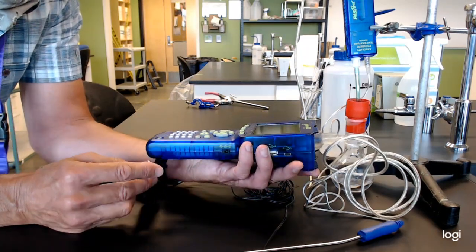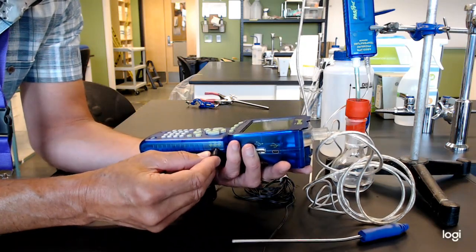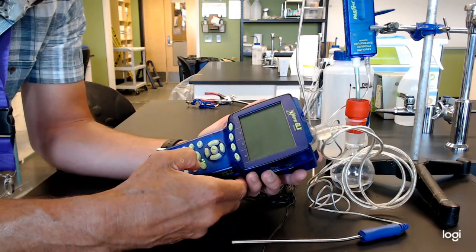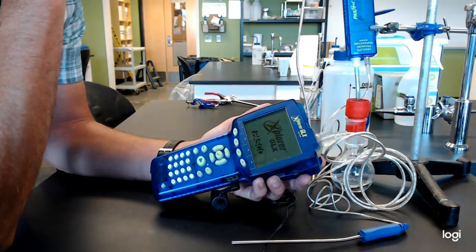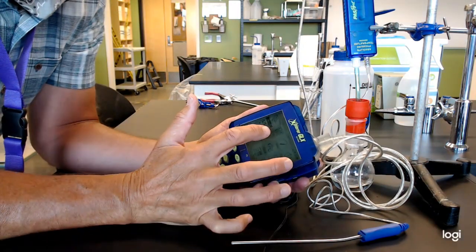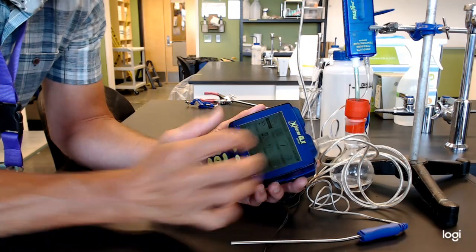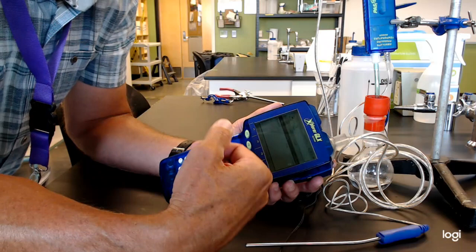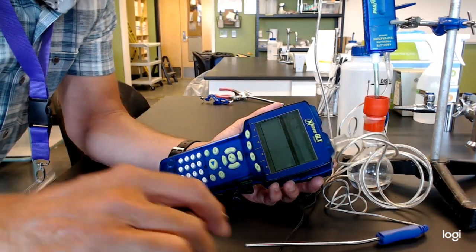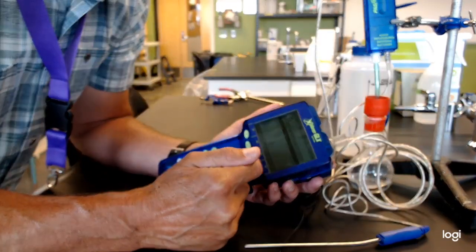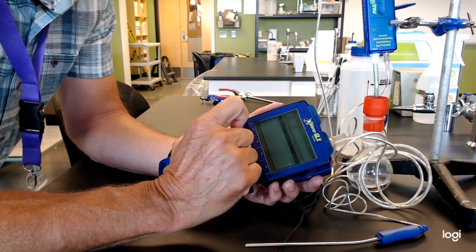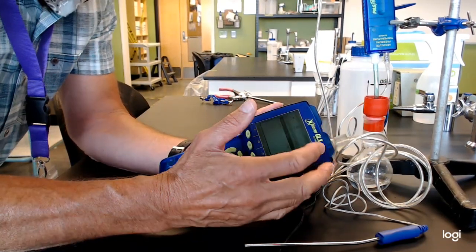There are features to save to files. With the time you have in lab, it's up to you whether you really get into training students on how to do that. But maybe I'll just show you real quick just so you guys know how to use this. Right here is the main thing that comes up on the home screen in the top left is actually the data file. So if I click that once, I'm actually looking at the data file. Just heads up, on here it says flash. That does not mean this flash drive. That is the memory for this. And then it has RAM. So when you're in RAM side, that means you're in that short-term memory of this thing. But if you want to work on saving things to the long-term memory, it's actually on this machine's flash. That's what that means.